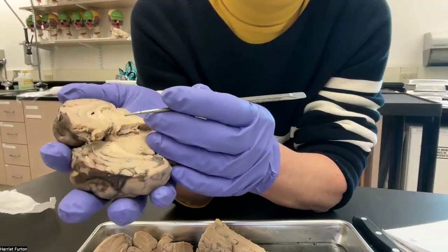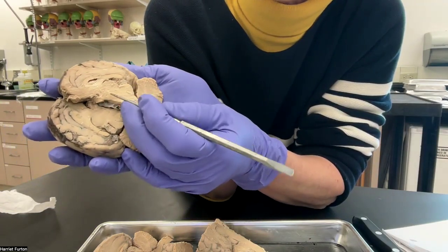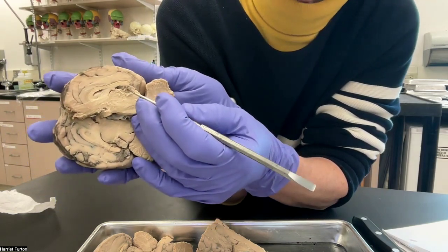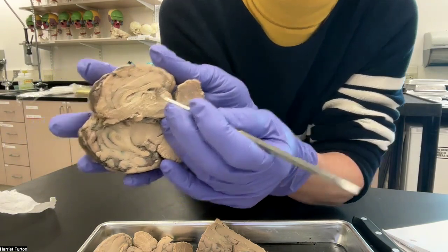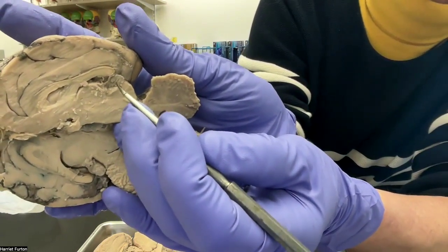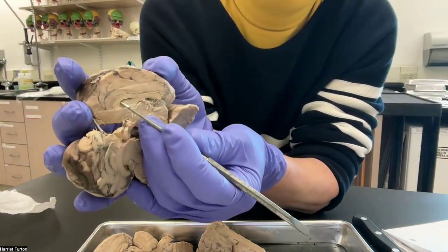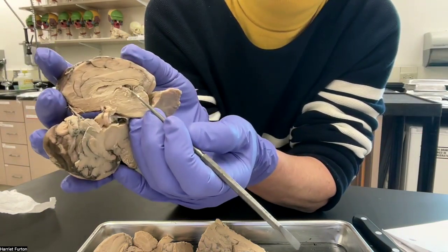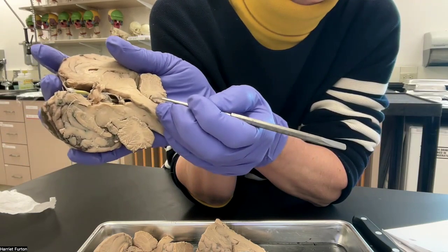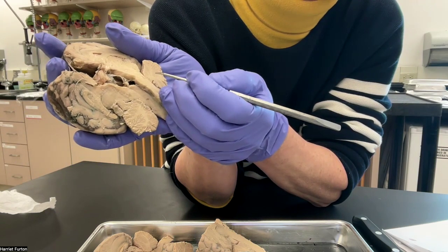What else? Oh, posterior or caudal to the thalamus is the pineal body, the pineal gland, the producer of melatonin. Do you see that, guys? I tried to check if you see it. That is the pineal body. We talked about the lateral ventricle and the third ventricle, and the fourth is here at the bottom, anterior to the cerebellum.